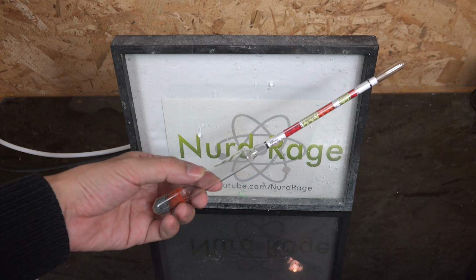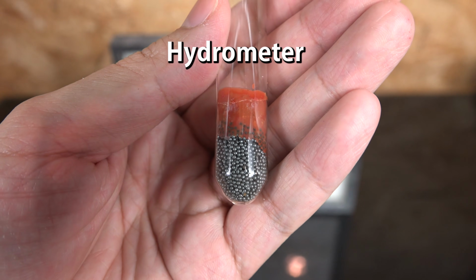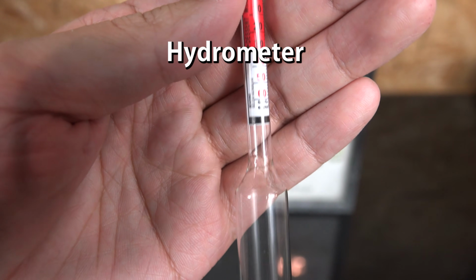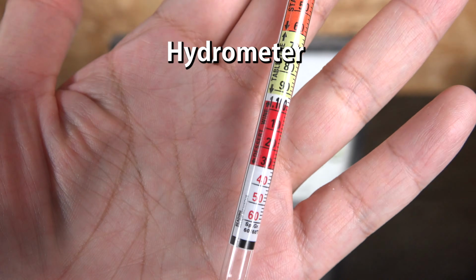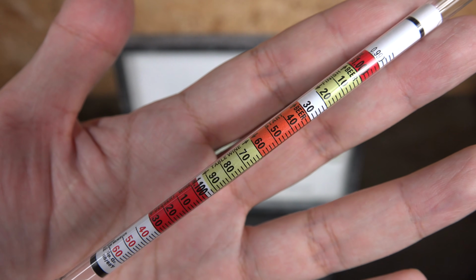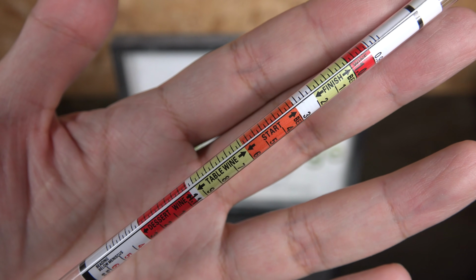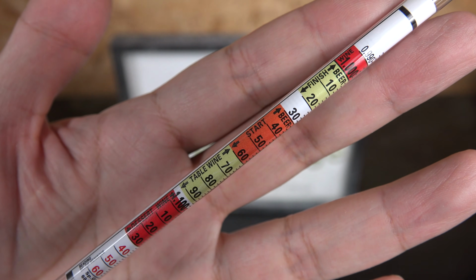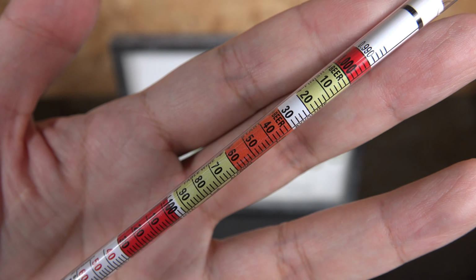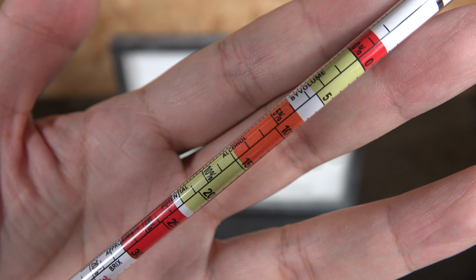The most well-known of these tools is the hydrometer. It just consists of a floater that's weighed down on one end with these metal ball bearings to keep it floating upright. The red wax keeps the ball bearings in place, and up here is a scale sealed inside. You can see here multiple scales have been printed on it, and since the biggest use of domestic hydrometers is for monitoring home brewing, these scales are for alcoholic beverages. As chemists, we are mostly interested in the scale for grams per milliliter. These are very inexpensive and easy to get. I got mine off eBay and Amazon for about $10.